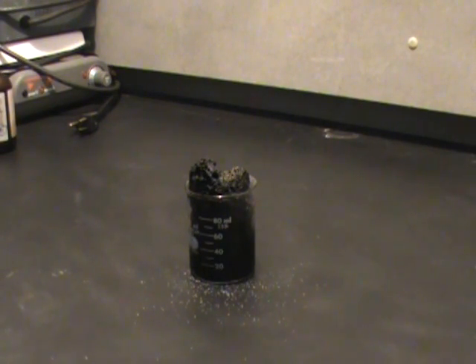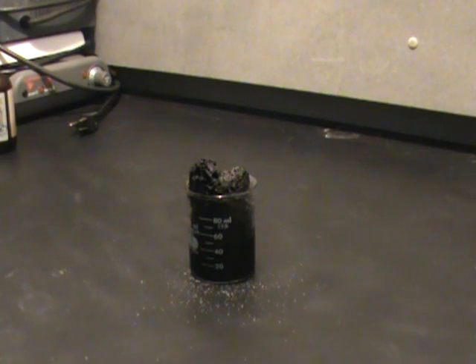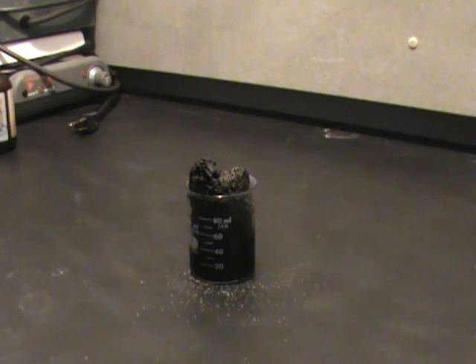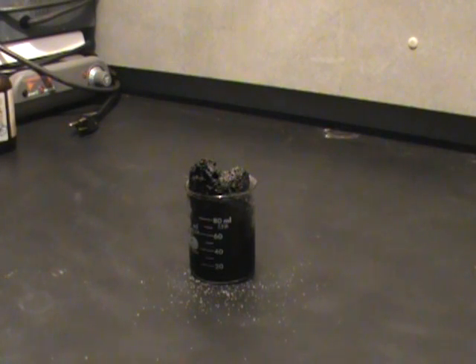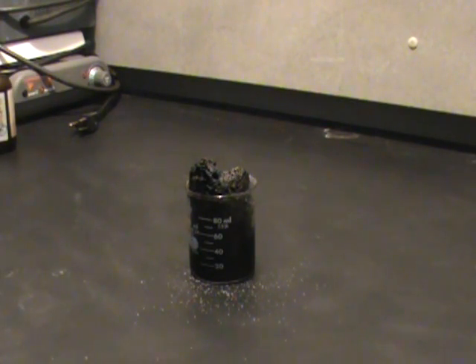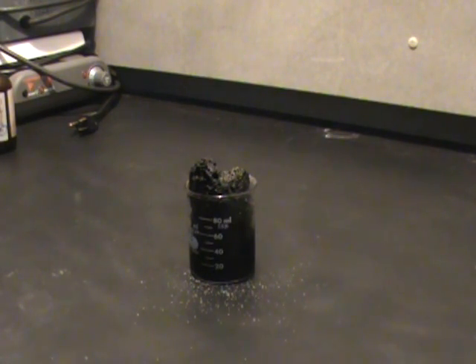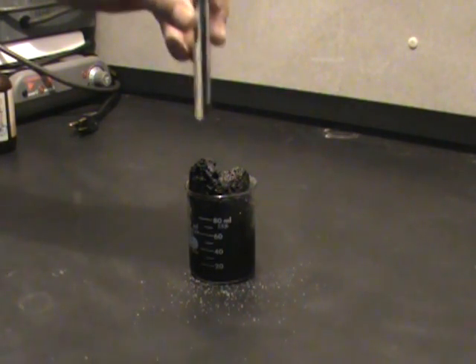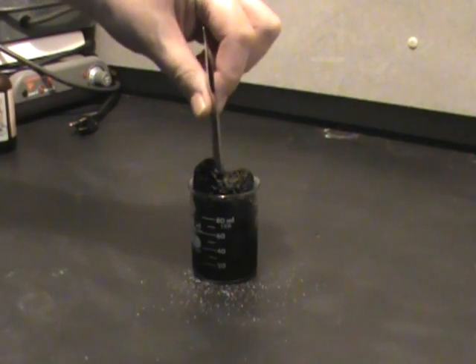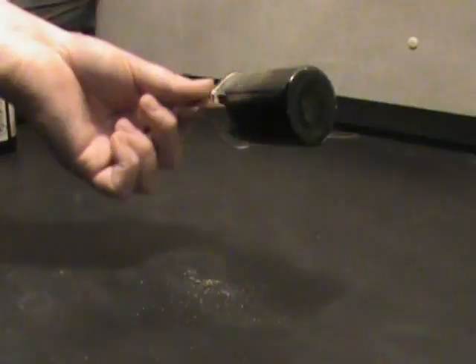If you take sugar, C12H22O11, and remove the hydrogen and oxygen from it, the only thing left is carbon. That's pure carbon right there, with some residue of unused sulfuric acid in it. Basically, it's coal.